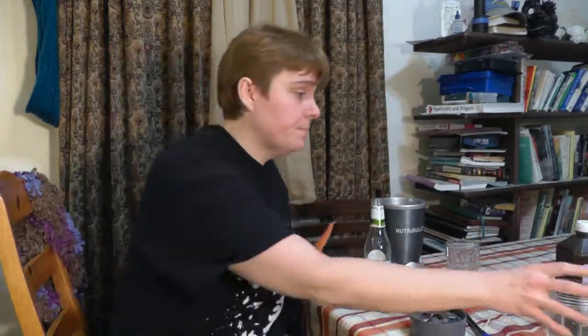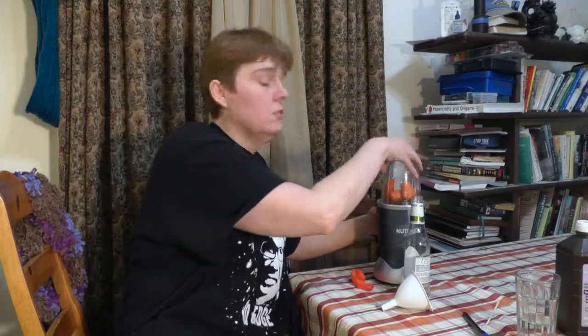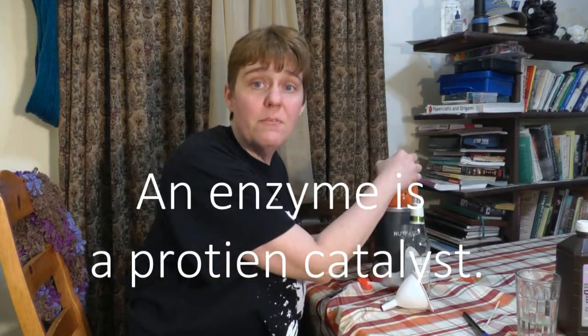We're going to demonstrate this with a carrot. I have a fancy blender here. I'm going to break my carrot up into little pieces, or big pieces, and put a little bit of plain water, which just helps to pulverize the carrot. We really don't need the water. And I'm going to blend it up in my fancy blender. You can use a regular blender though. This is just to break open the cells so the enzyme can get out where it can do its job faster.